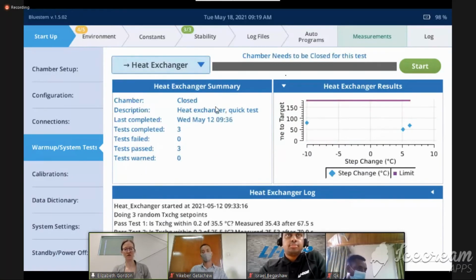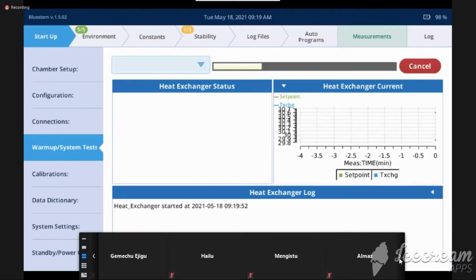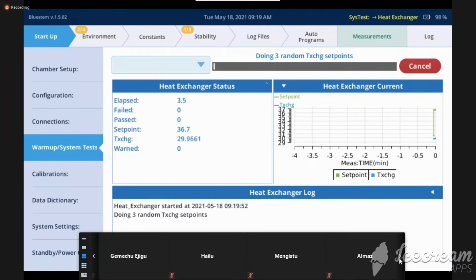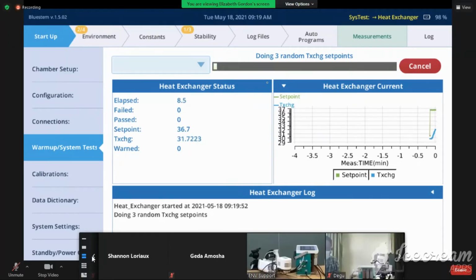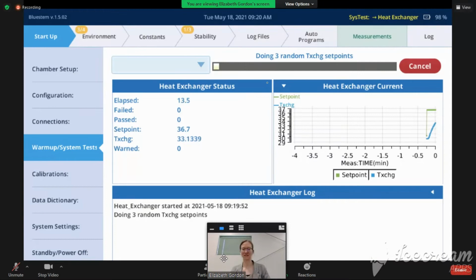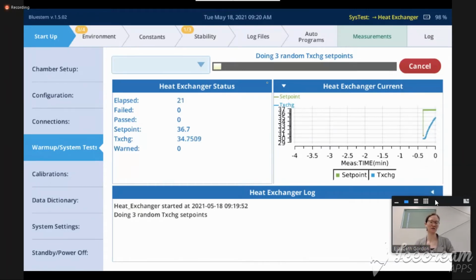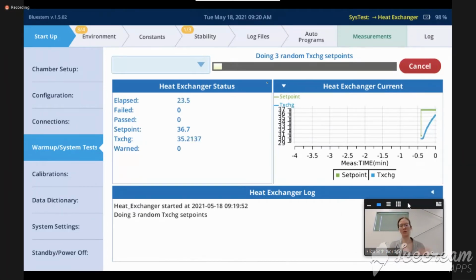I'm going to go to the heat exchanger. Now this is the noisy test, because what I'm going to do is try a few different set points for whether I can lower the temperature in the chamber and whether I can raise the temperature in the chamber. And because of that, it's going to be a little bit noisy. It usually picks something. It says it's 3 random T exchange set points. I've noticed that it likes to do somewhere around 20 and 35 C. It changes a little bit, but it seems to like those, maybe with the idea that if you were at room temperature, if you were at 25 C, then it would be up and down from there.